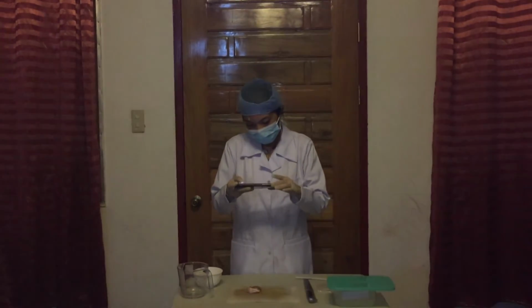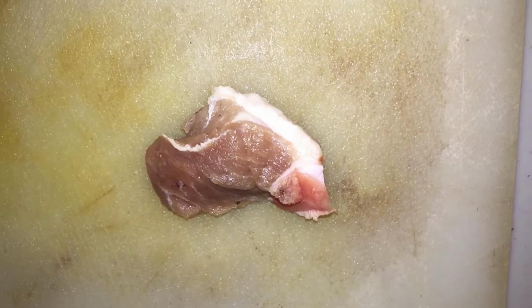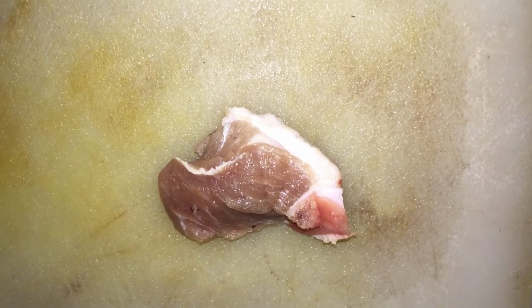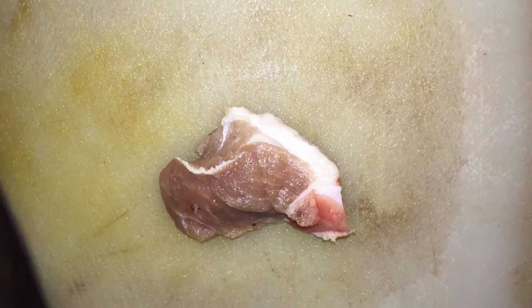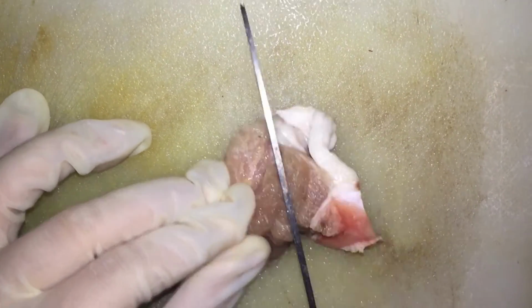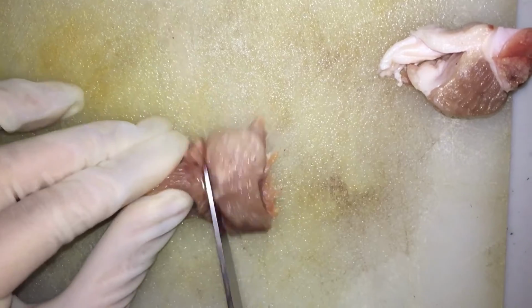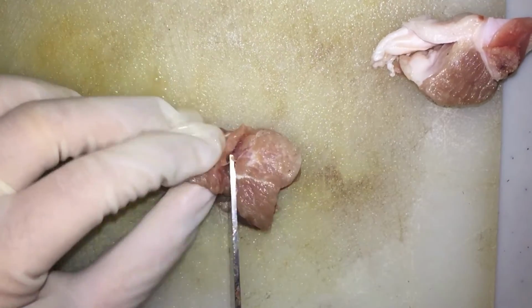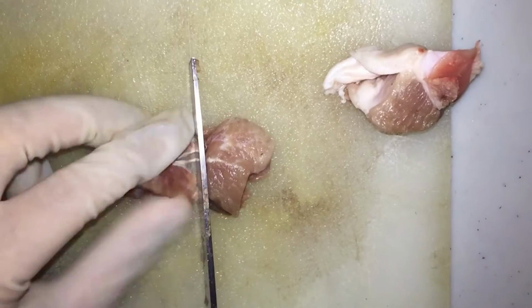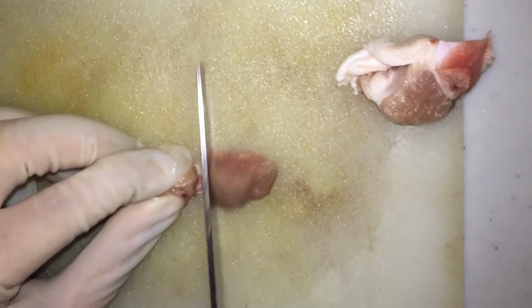When we are done with the gross examination, images of the tissue are usually taken, which will be included in the patient's report. Next, we will choose a representative specimen by using a scalpel or knife. We need to cut it into 2 centimeters squared but not more than 4 millimeters in thickness. This is done so that the tissue specimen will be able to fit in our tissue cassette later on. If thickness exceeds 4 millimeters, then we will not be able to close the tissue cassette.